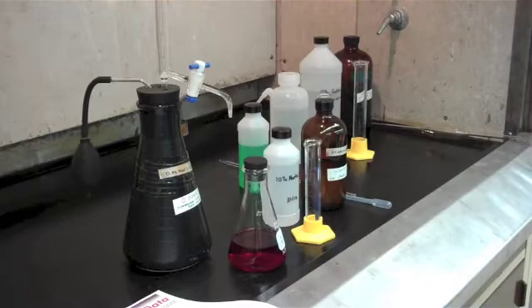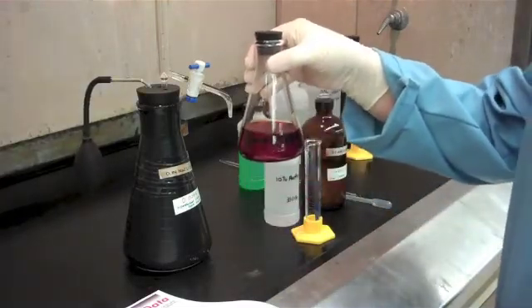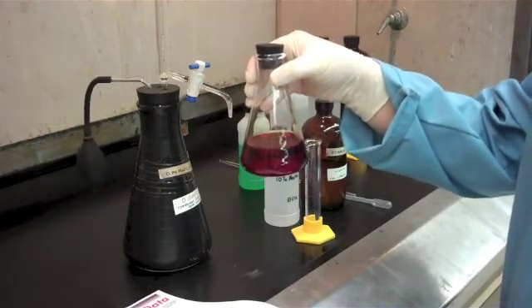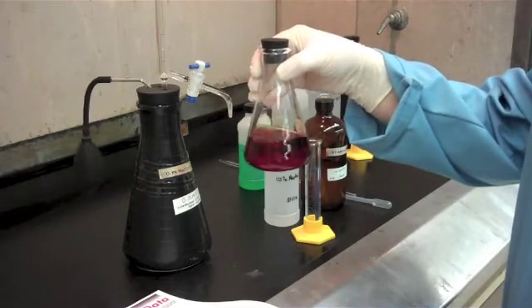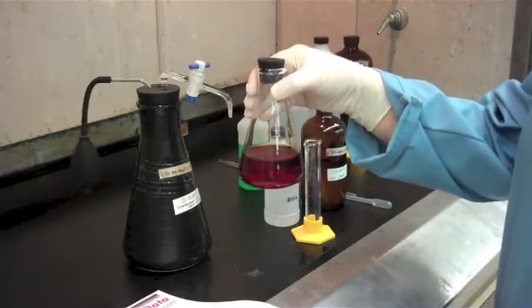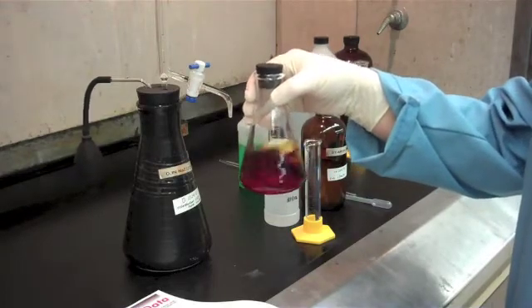So now 30 minutes have gone by, and we have our solution. If you were to take your solution out of the dark after 30 minutes and it was clear, that means there is a lot of orthophosphite in the bath. So you would either want to add more iodine or take a smaller sample size.